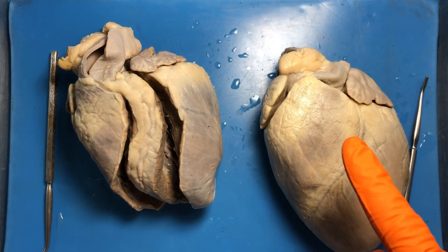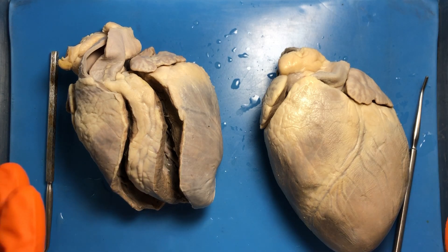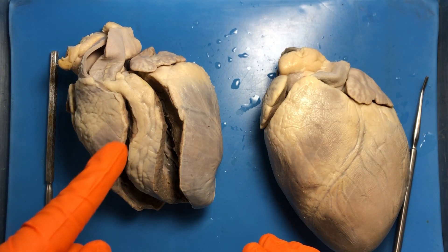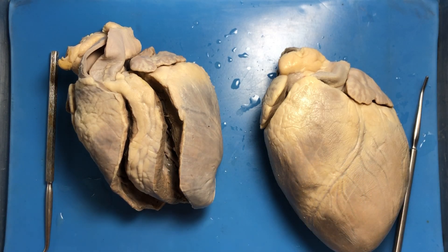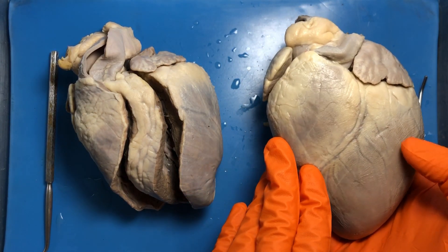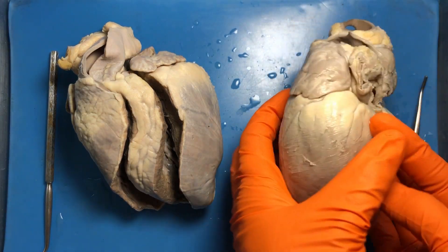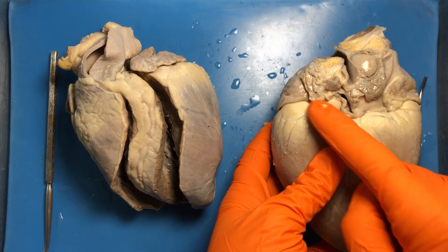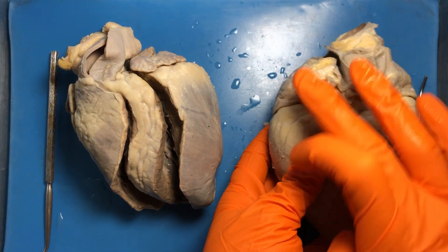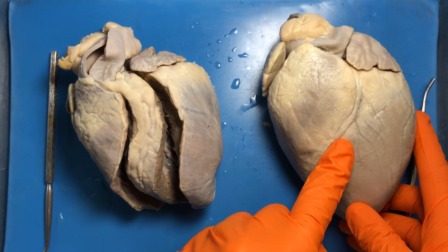On the right hand side we have a whole uncut heart; on the left hand side we have a cut heart. It's a good idea in the lab to have both so you can compare the two. To know if you're looking at the anterior or posterior side: the anterior side is a little less busy. When you flip it over and see all the pulmonary vessels and other vessels, that busyness means you're looking at the posterior side.